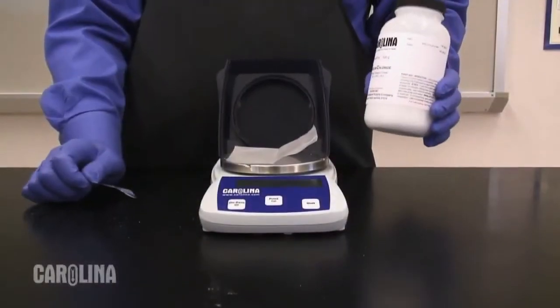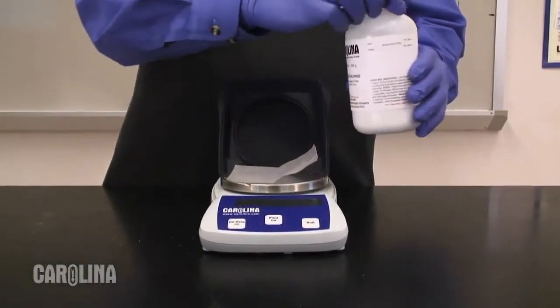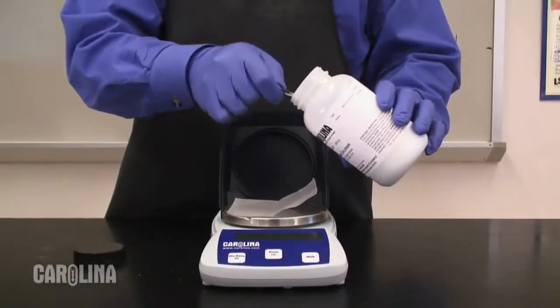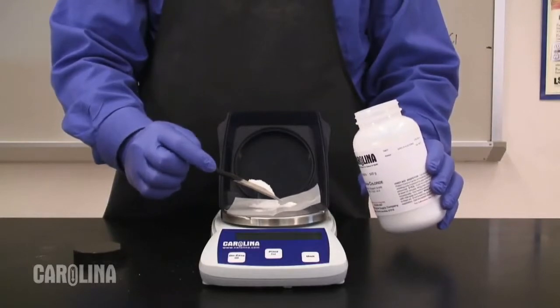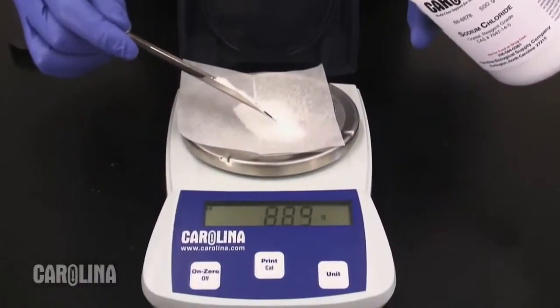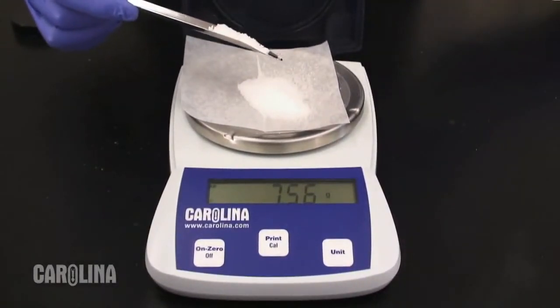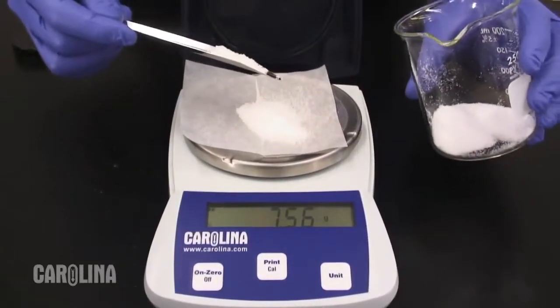In lab, obtain some sodium chloride in a clean lab scoop, and using a balance with some weighing paper, measure out as close to 7.304 grams as possible, marking down your exact mass. Note that if you go over the desired mass, it's never appropriate laboratory procedure to put the excess reagent back into the original container. Always use an additional container to collect the excess.